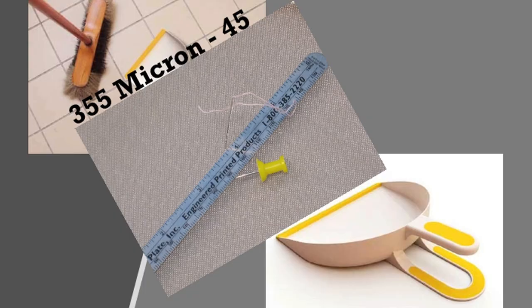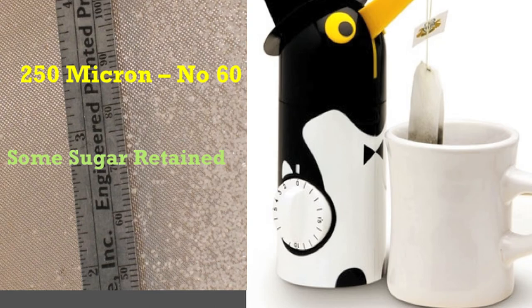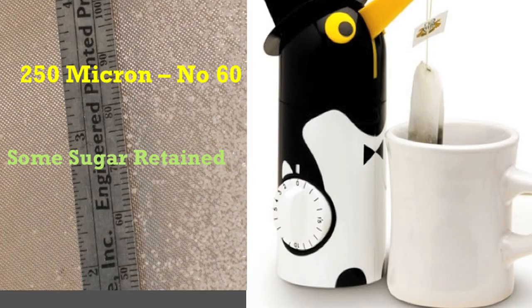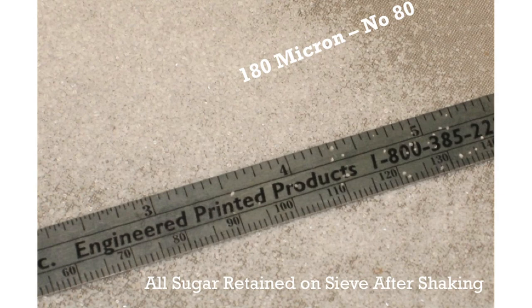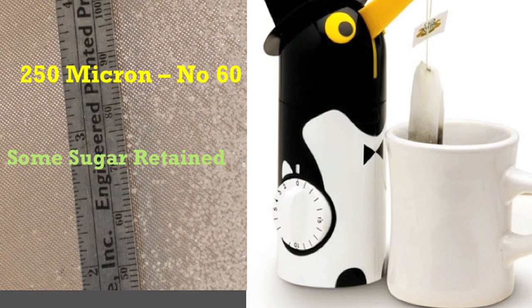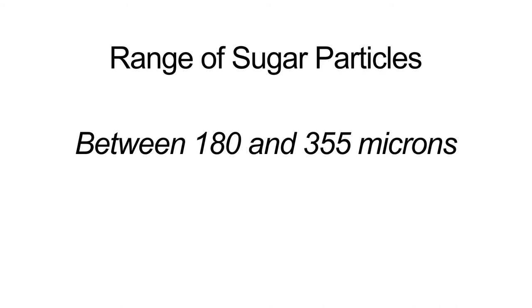Next, we test some sugar using three mesh sizes: 355 microns, 250 microns, and 180 microns. We find that all the sugar goes through the number 45 or 355-micron sieve. Some of it passed through the number 60 or 250-micron sieve, while some stayed on the surface. None of the sugar that went through the 60 sieve passed through the holes in the number 80 sieve. These results tell us that sugar particles were all smaller than 355 microns, that some were larger than 250 microns, and that none were smaller than 180 microns — so the range of the sugar particles was between 180 microns and 355 microns.